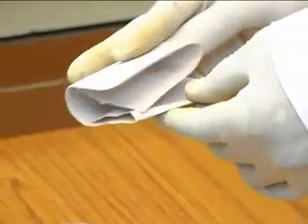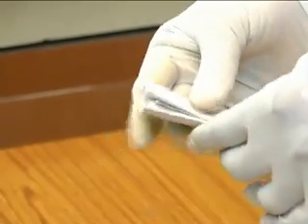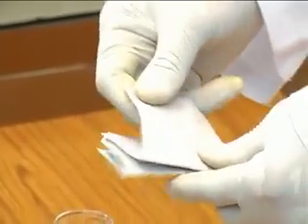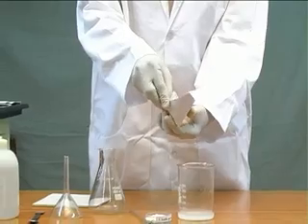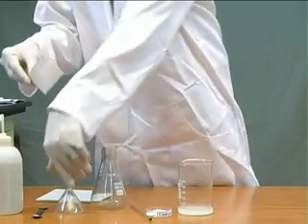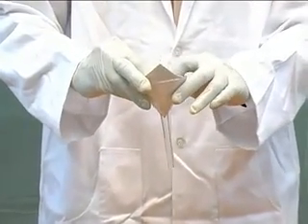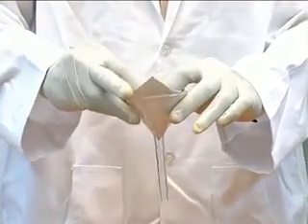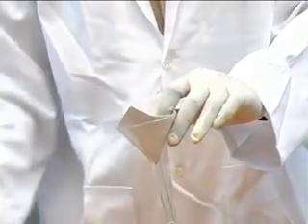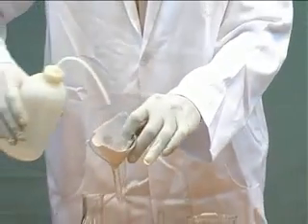The filter paper is folded into four folds as shown here, and then opened from the folds so as to form a cone and fit into the funnel. It will stick to the funnel if a few drops of water are added to it.